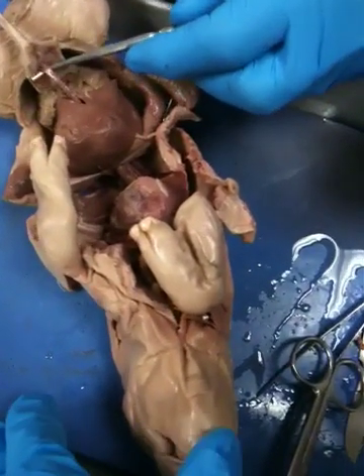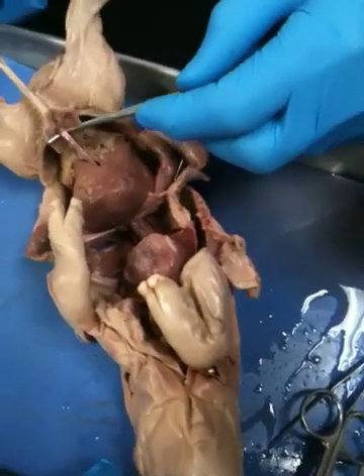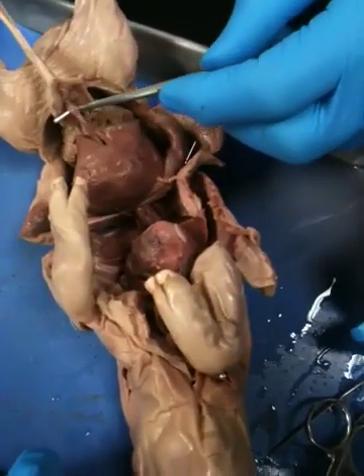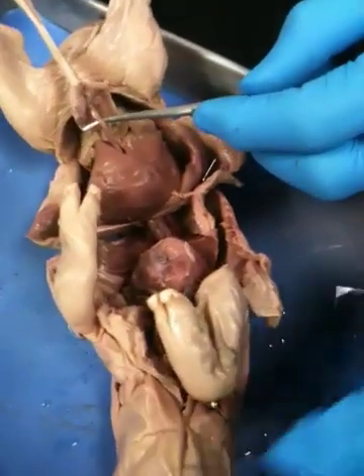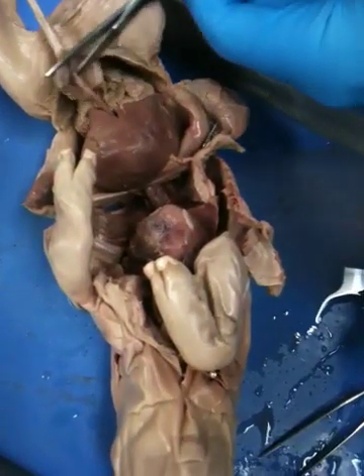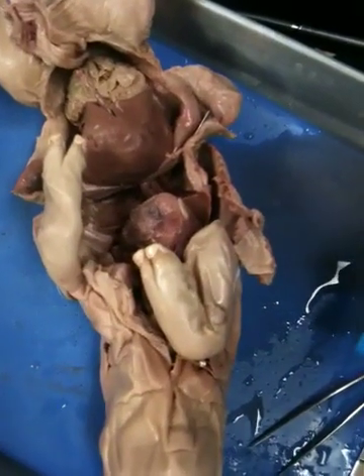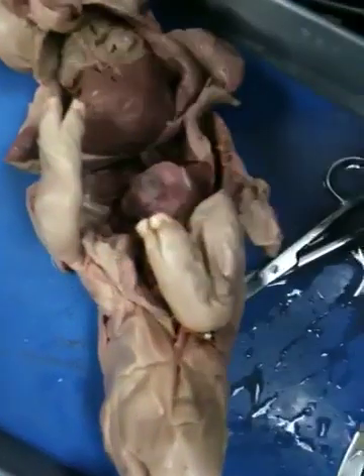What's the vessel? It carries blood. Blood carrier? So what's the name of it? Is it the inferior vena cava? Does the inferior vena cava disappear when you're born? So is it the aorta? No longer there? No. What is this?